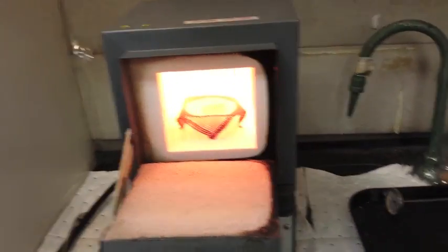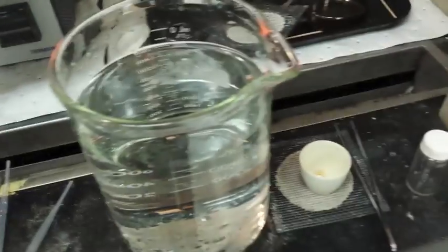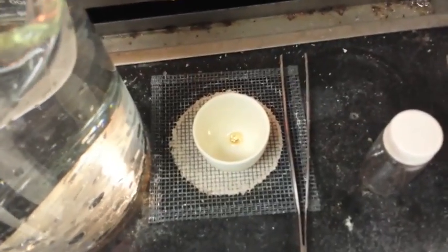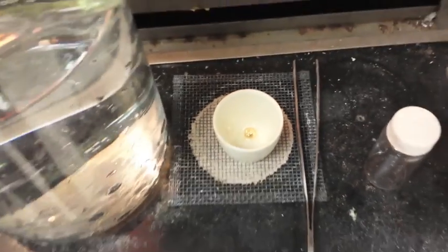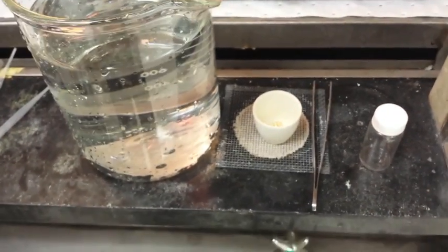We'll turn this off. Whew. That is hot. There's our gold. So I'm going to let this cool down, and see if I can get it out without cracking the porcelain.